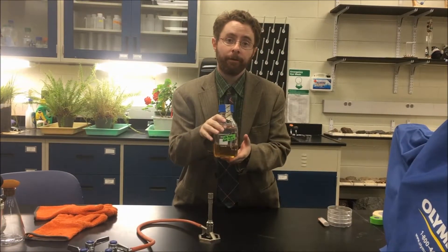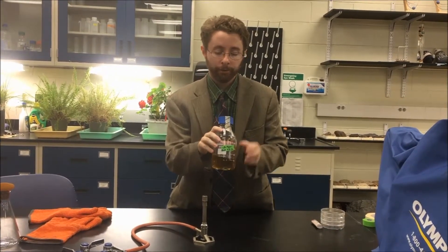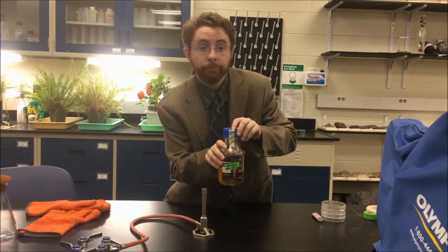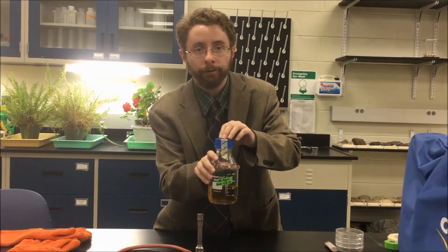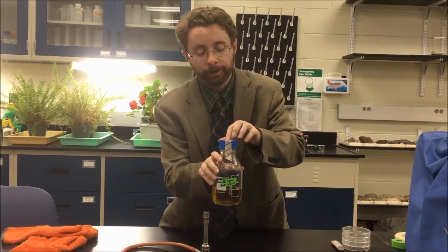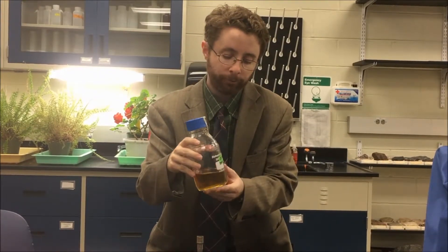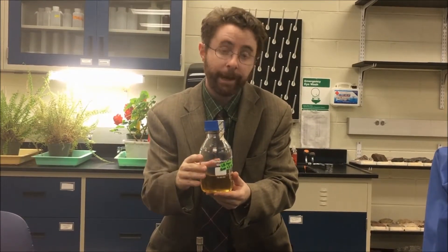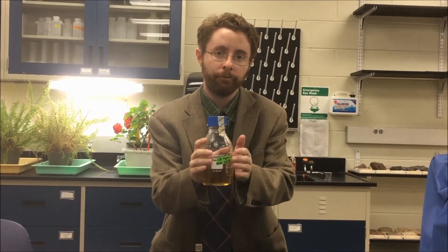Here we have our media with the agar that came out of the autoclave and has cooled off in a water bath. If you look at the tape, you'll now see that it has black lines on it, showing that this has been in an autoclave because the increased temperature and pressure resulted in the tape changing from white to black. Now, if we need to add any antibiotics or special indicators like X-gal — for example, if you're doing blue-white screen cloning — this would be the time to add it to your media.